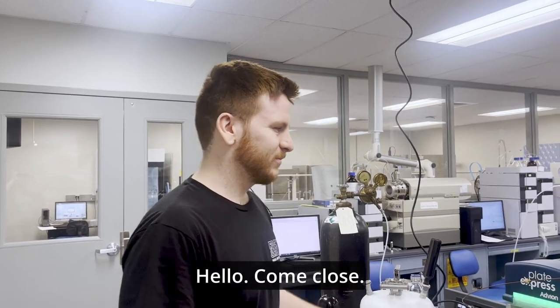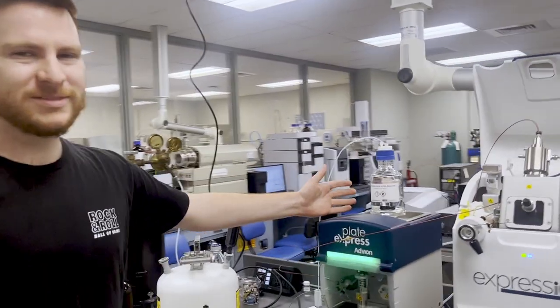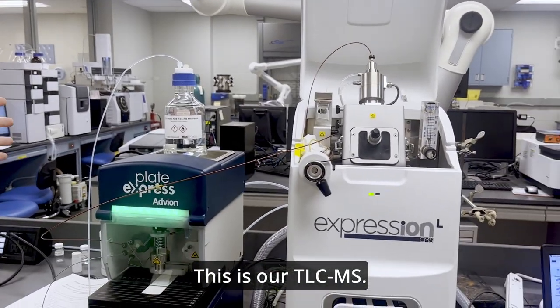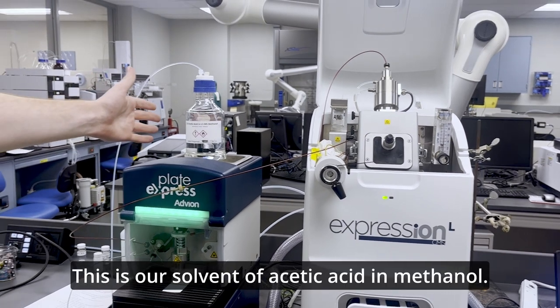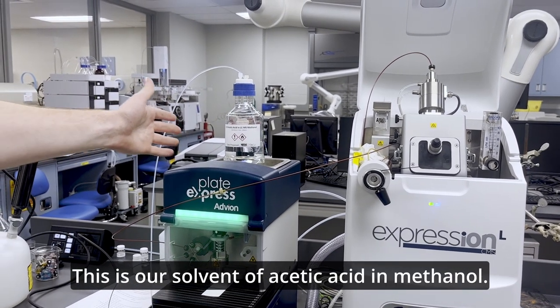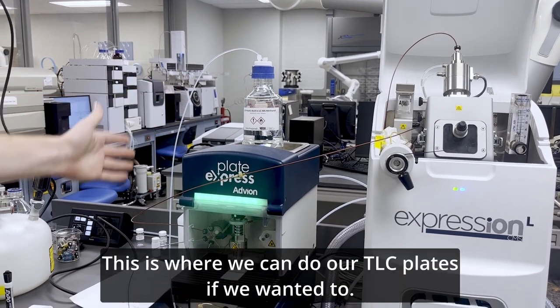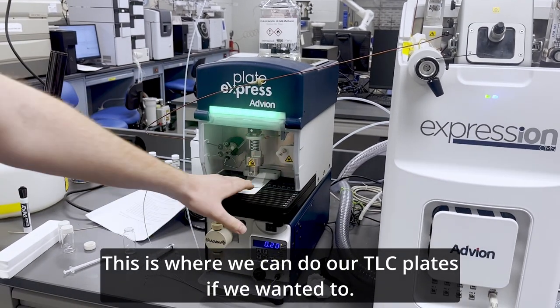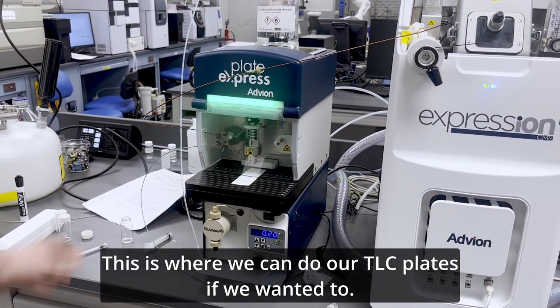Hello, coming close. This is our TLC-MS. This is our solvent of acetic acid in methanol. This is where we can do our TLC plates if we wanted to.